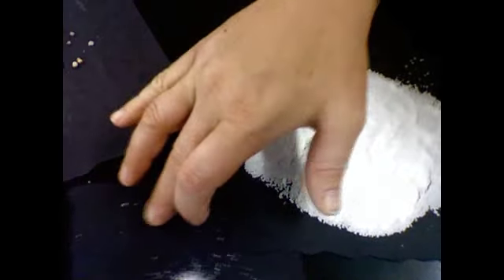So even seeing if they make noise, the powder, ooh, I spilled some. The powder does not make any noise at all. And the gravel does, and the salt does as well. I don't know if that'll help us in our investigation, but anything we can find out about a material helps us understand it better. Those are some great properties that we noticed.